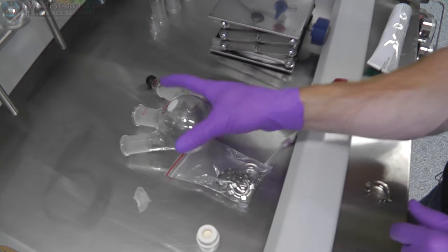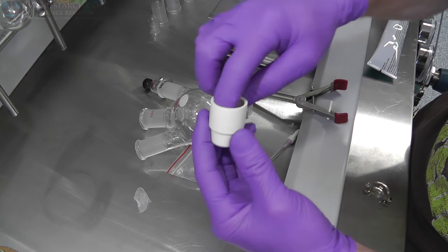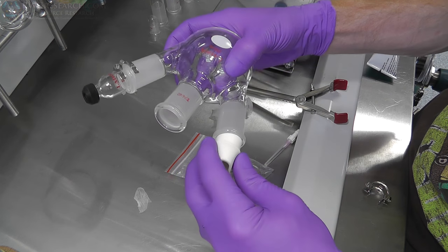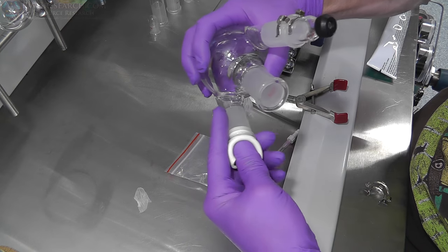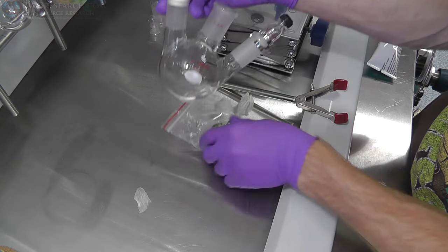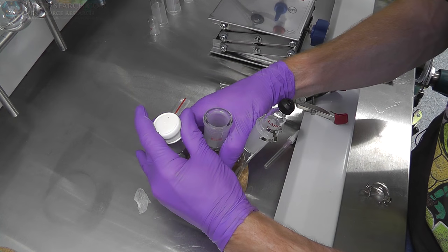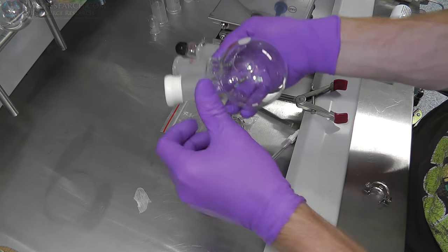As I'm assembling something, just to kind of show you guys what this will look like when it's all together, I'm going to show you this little component. So this is actually what they call a septa. Alright, so this happens to fit this particular size. So this goes in here like this. And then this gets folded on top of itself. Like that. Okay, so now, oh, it didn't go on well, did it?